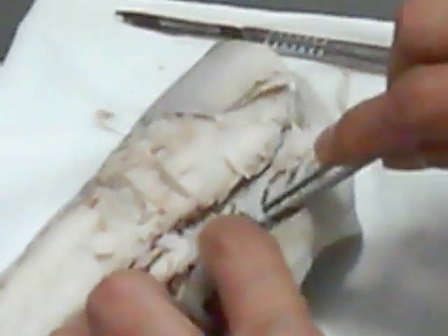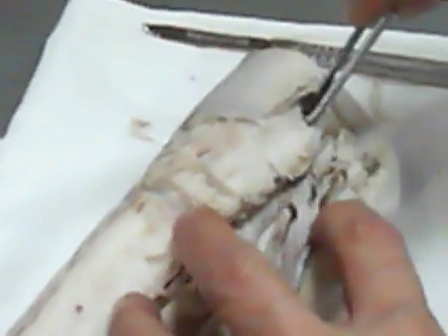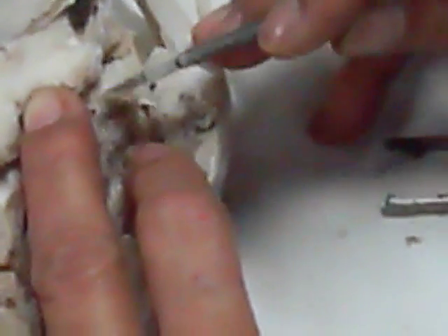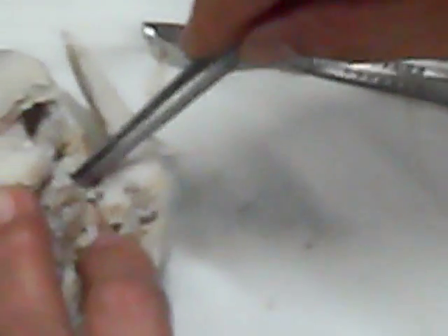Remove one of the pelvic fins together with one of the claspers. The point of entry of the colon to the cloaca is what you call the coprodeum. The one that you can see here is now the urodeum. This will join together and form the urogenital papilla, with an opening at the tip. Right after the papilla, you will see the proctodeum. And this one is the anus.